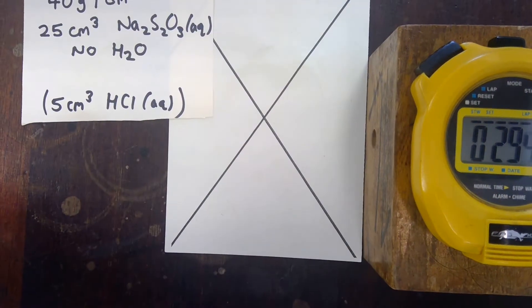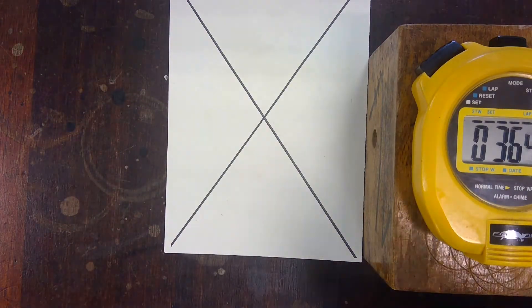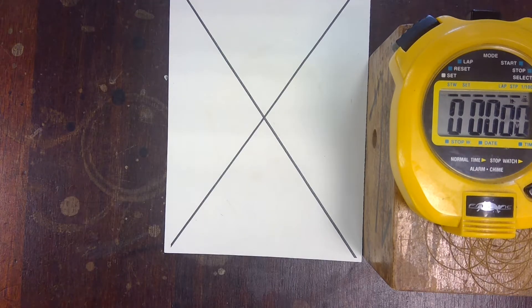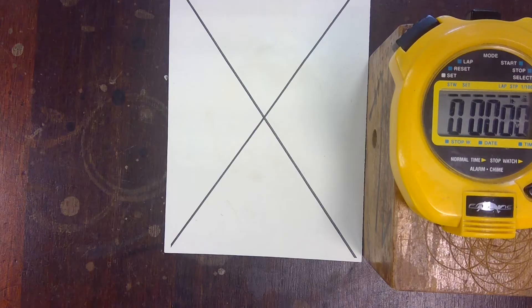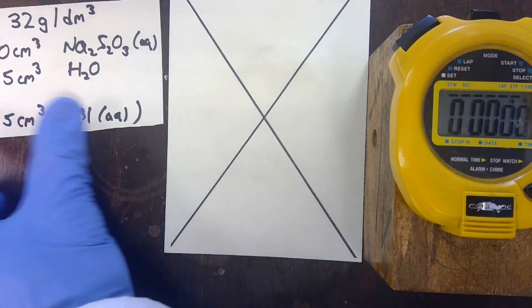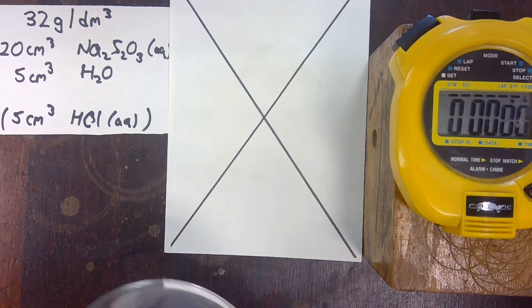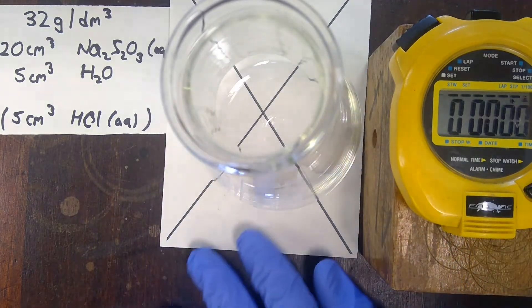The second experiment uses a lower concentration. We're going to create the lower concentration by mixing 20 cm³ of the 40 gram per cubic decimetre sodium thiosulfate with 5 cm³ of water. This will give us a concentration of 32 grams per cubic decimetre. So the second experiment works with 32 grams per cubic decimetre: 20 cm³ of thiosulfate and 5 cm³ of distilled water.